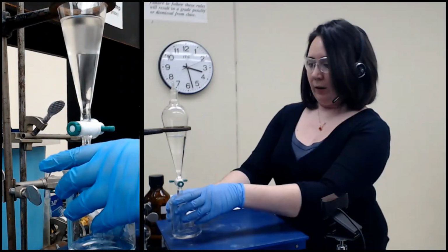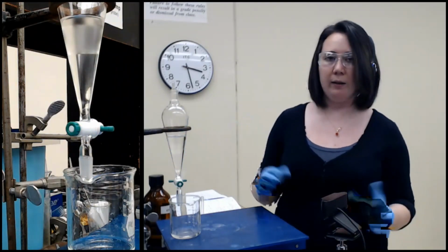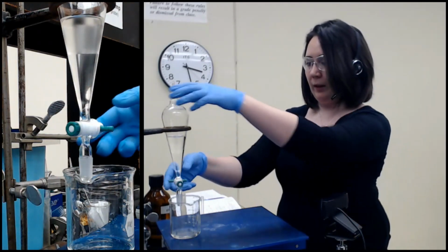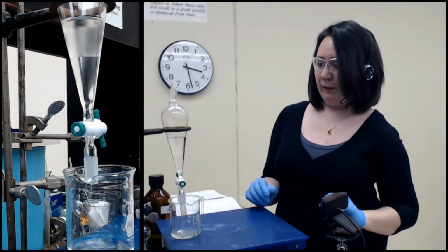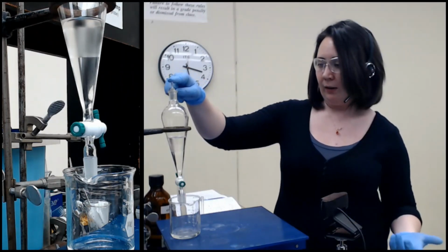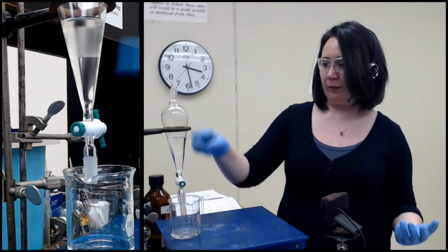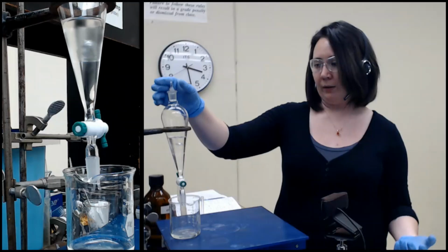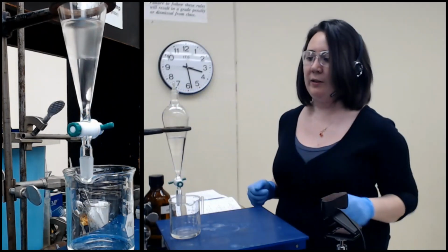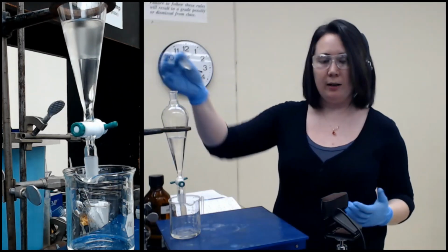And now that this is ready to go, we are going to drain it again. Again, the aqueous layer is still on the bottom, the organic layer still on the top. I'm going to combine my aqueous layers. And what you're going to see here is what happens when I forget to take the top off. This is a very common mistake I sometimes make. You can see some came out at first, but now there's no more movement because we've made a vacuum. Some came out, but there's no way for air to get back in unless it chugs up like that, which is just going to mess up the layers and make stuff more difficult. So if you ever see it's really slow or it's not working, just check if you left your cap on.